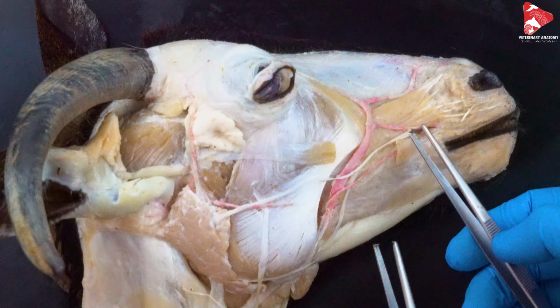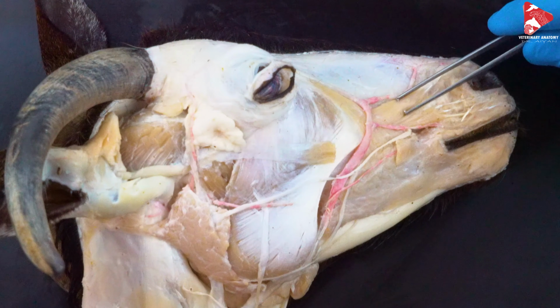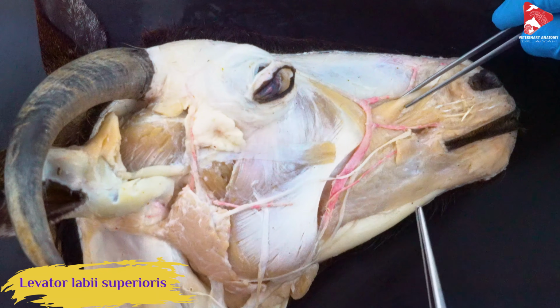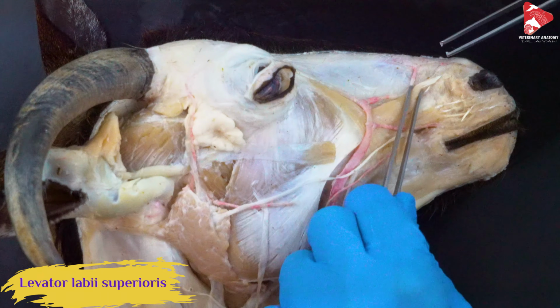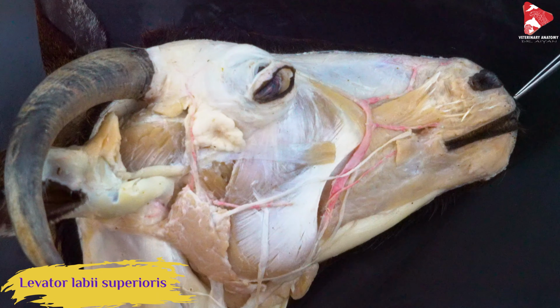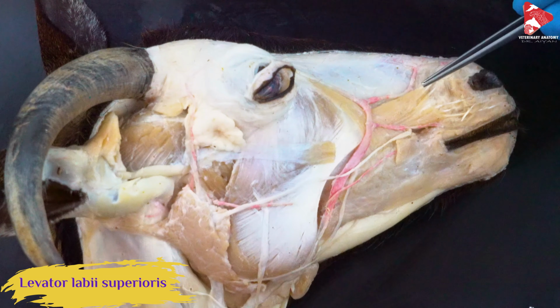The next muscle we are going to talk about is the levator labii superioris. The origin of this muscle is from the maxilla somewhere there, and if you follow the tendon of this muscle, it will move all the way up here, meet the tendon from the muscle on the other side, and insert to the upper lip, and that's why we name it labii superioris.